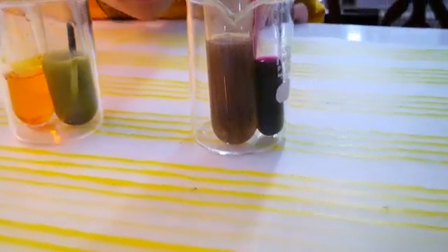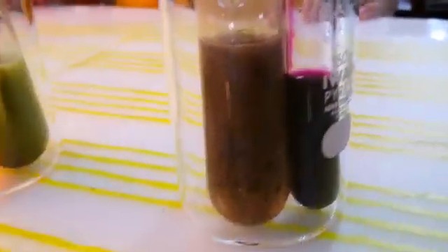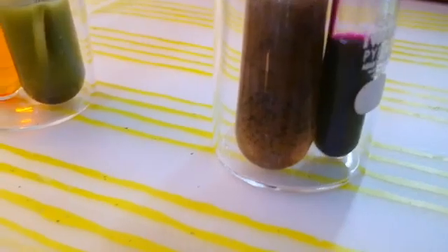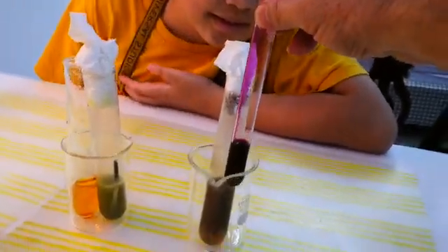You can start. On your left — on my left — potassium permanganate. What do you have? What is the color? Purple potassium permanganate.